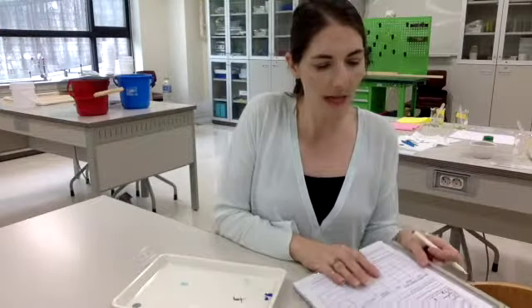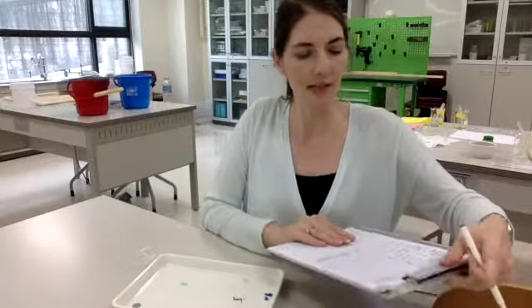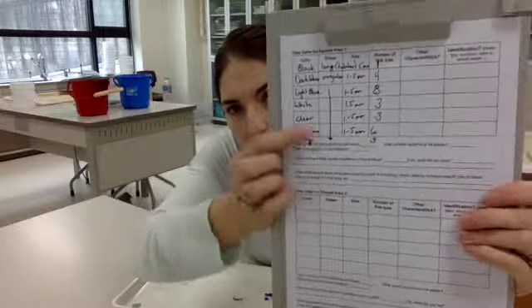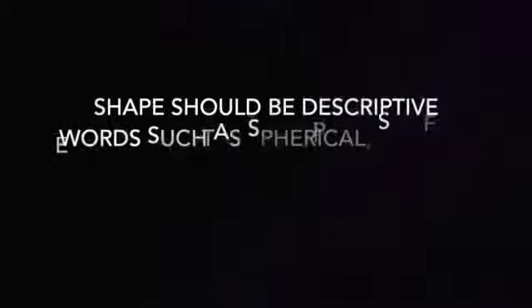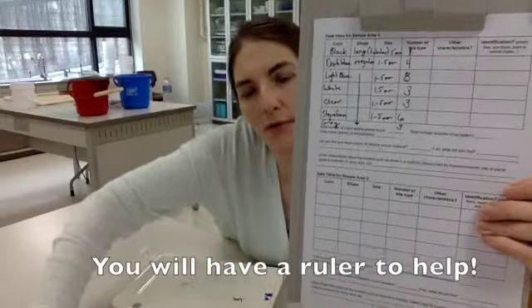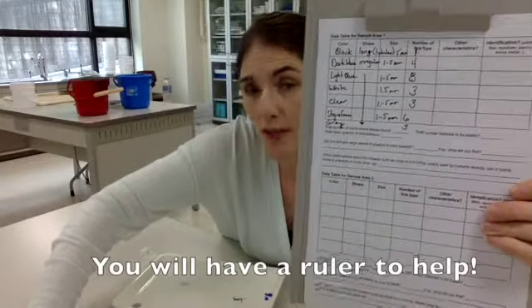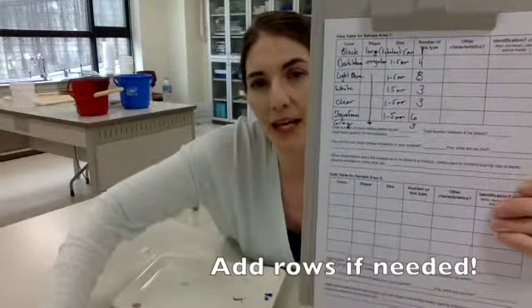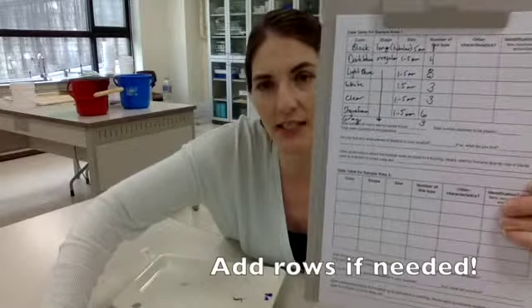So I started to fill out my data table, and I'm not going to fill this out completely for you because we want to see what you come up with. But I have things like color, shape, size, and for size I put if it was between 1 to 5 millimeters or less than 1 millimeter, so approximate size, and then how many of that type I had. Any other characteristics, go ahead and put that in. And if you think you know what it is, you can fill in the identification.